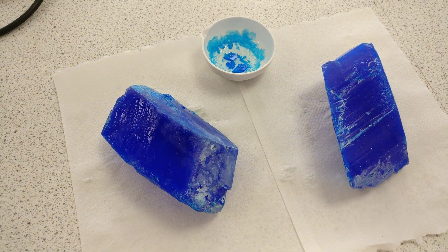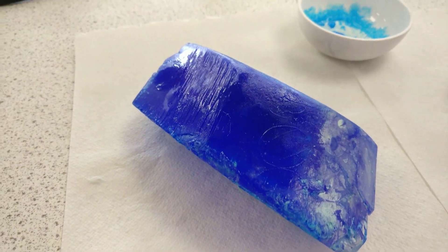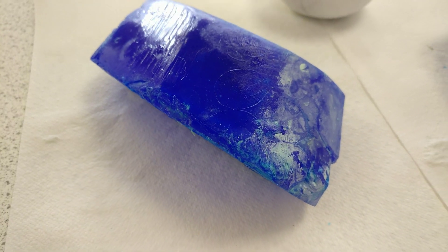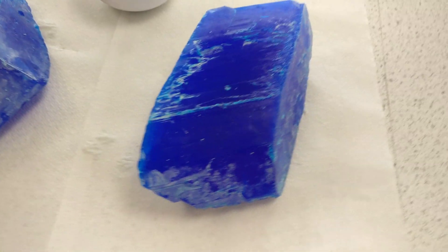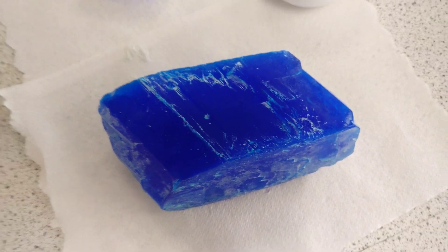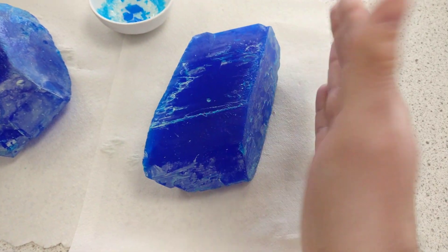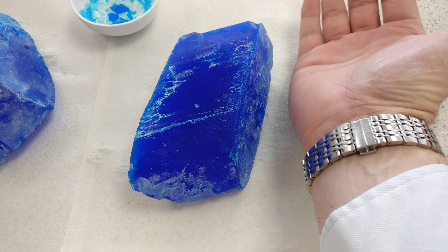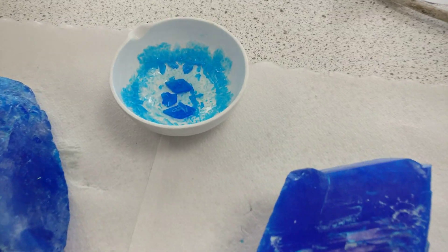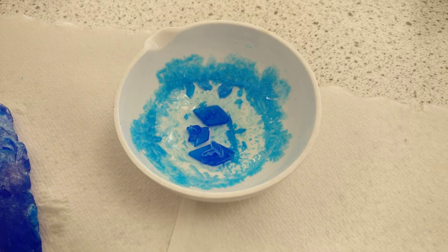Welcome to Animated Science — it's not a physics video today but chemistry on a Saturday morning. I've got here some copper sulfate, and here are quite frankly two of the largest crystals I have ever seen of copper sulfate. Clearly they are huge — that's my hand. You can see how big the crystals are; that's your typical evaporating basin, and there are some quite large crystals.